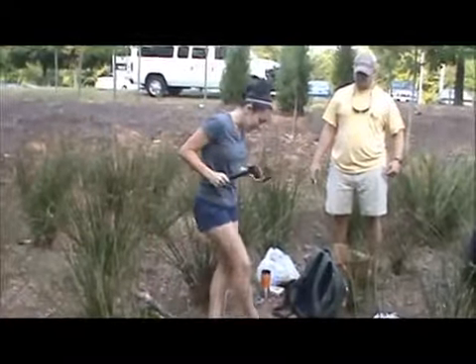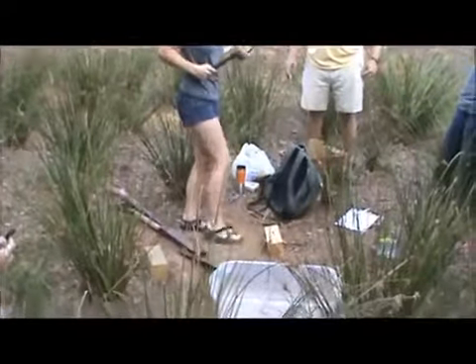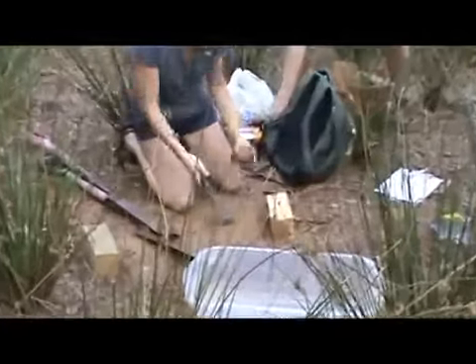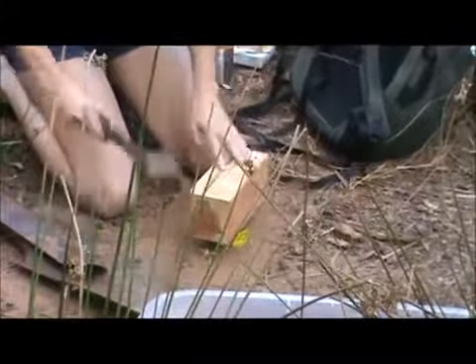This can be difficult because, as you can see, it's really sandy and right now it's kind of dry. We should have brought water out here to wet it up. You're going to move the mulch out of the way because we just want to get the soil, then you're going to set this on top and hammer it in.